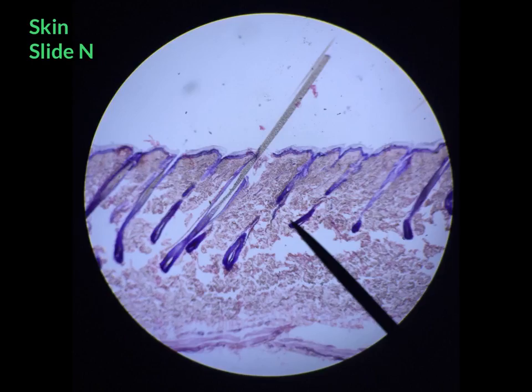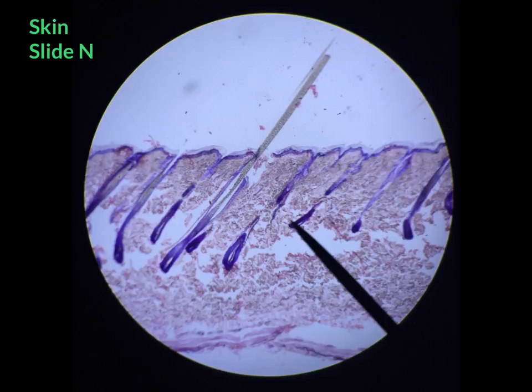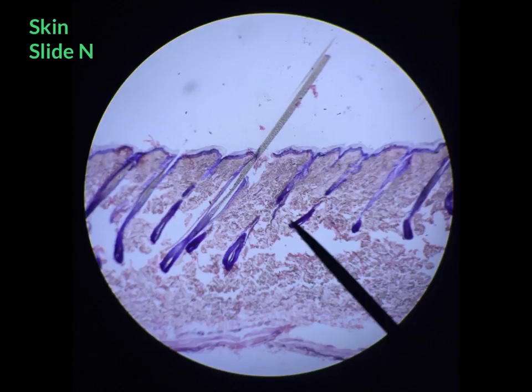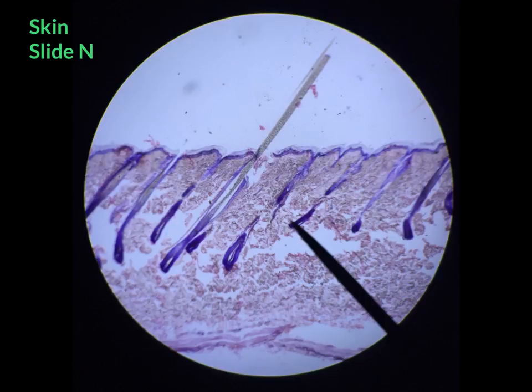Next we're going to take a look at dense irregular connective tissue, which you can find by looking at the skin on slide N.